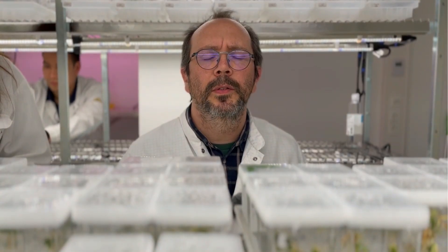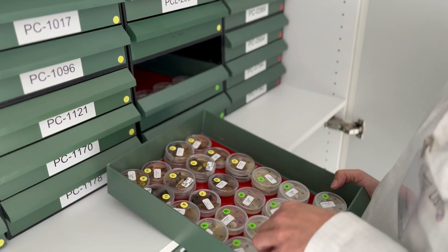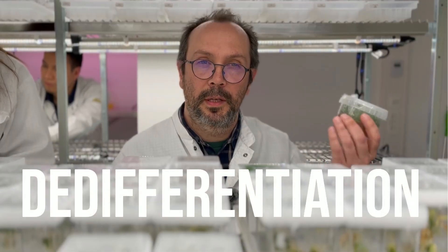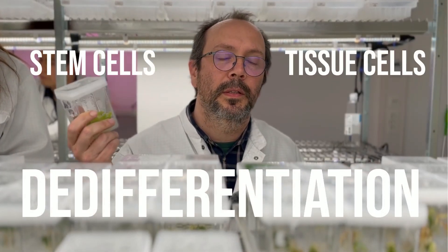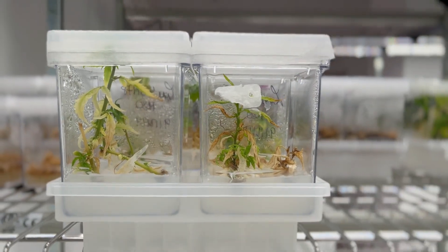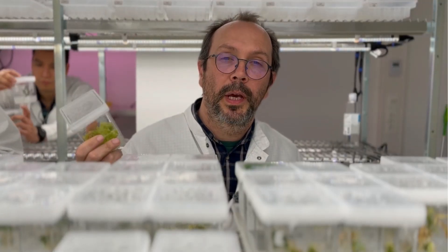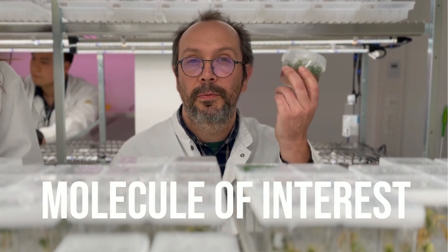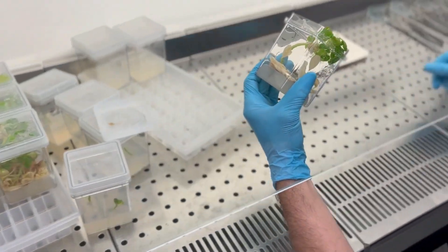Instead of growing plants in the field and using arable lands, we are using the unique ability of plants to de-differentiate their tissue cells into a kind of stem cells. These cells we are able to grow in bioreactors, and they also have the ability to produce the molecules of interest that we found earlier in the plants.